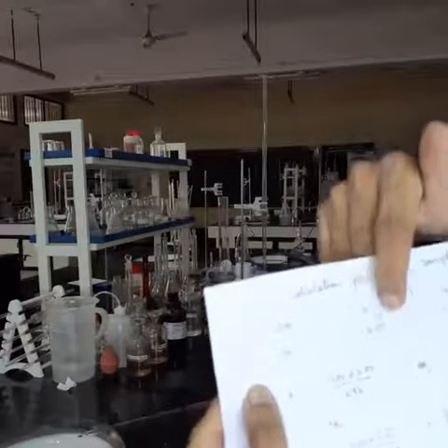This is a 300 ml BOD bottle where you have taken the sample. Due to the reagents that you have used, you need to deduct 4 ml of the sample. Those 4 ml indicate the reagents that were added to the 300 ml sample. Now you need to take 200 ml of this. So for 300 ml, 296 ml will be the actual sample of the water that is to be tested.